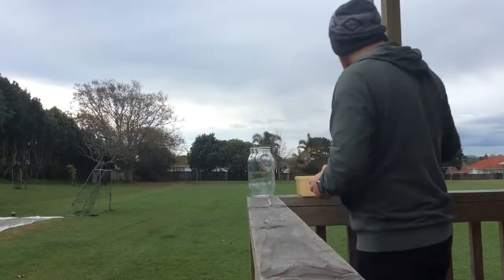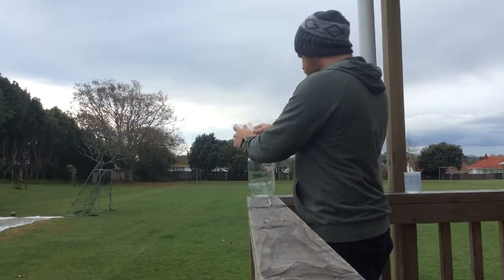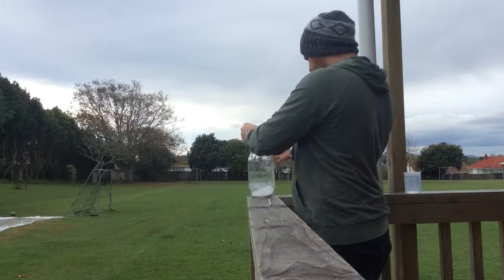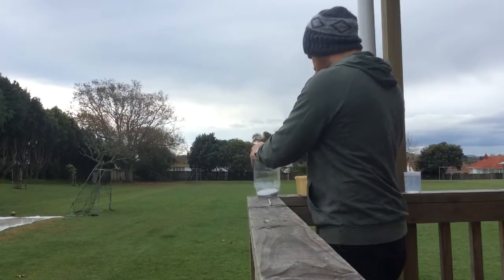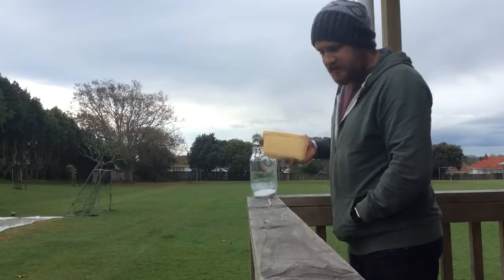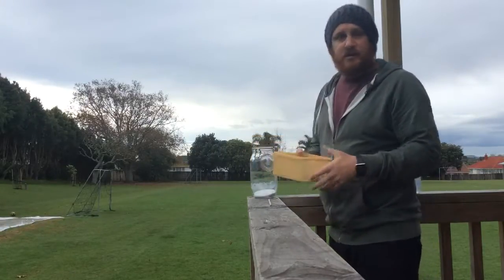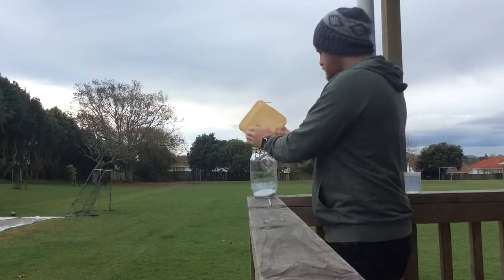So basically what we're going to put in first is Mr. Ashley's secret powder. That's the other reason why we're doing it outside and not inside, because with it being exothermic and those gases being released, we don't want to do it in an enclosed area.